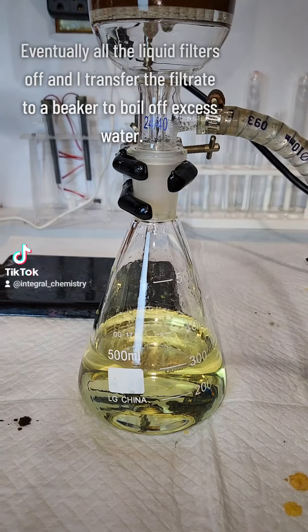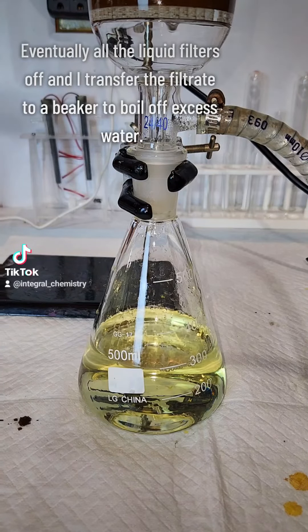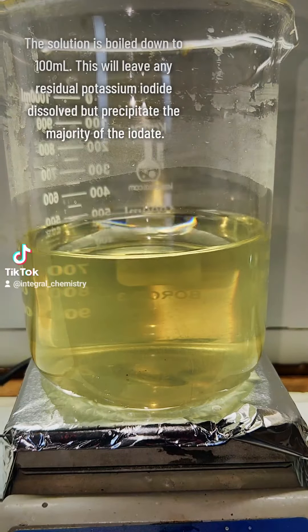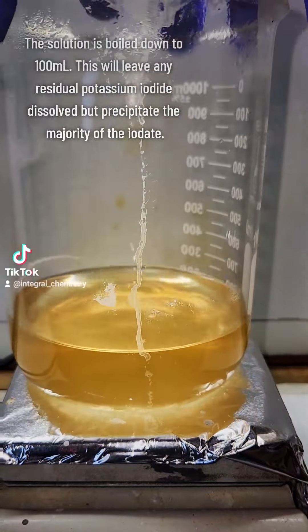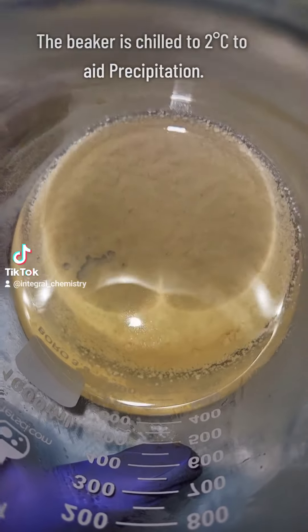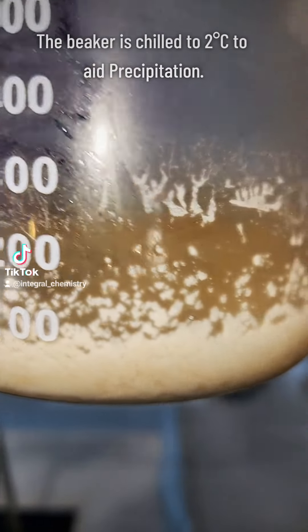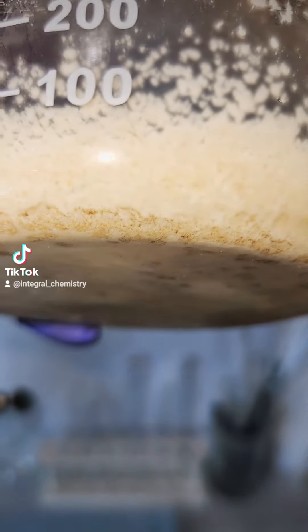After about an hour, I was able to filter all of the liquid off, and I'm left with a very light yellow potassium iodate solution. I then put it on a hot plate and boil it down to about 100 milliliters before tossing it in the freezer to cool down. This step is going to cause the potassium iodate to crystallize out while any potassium iodide that didn't react is going to stay dissolved in the solution.